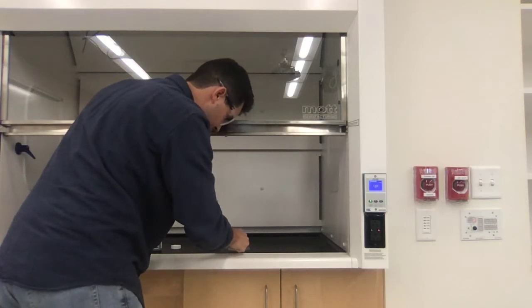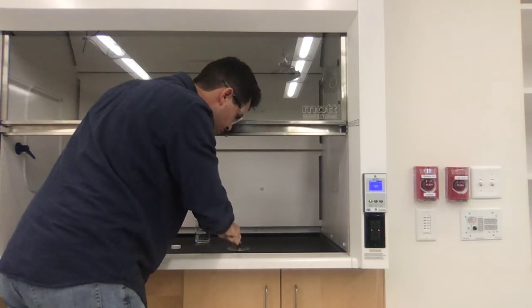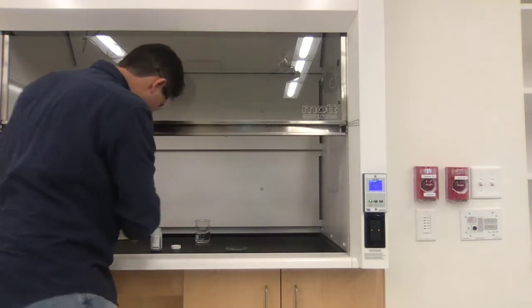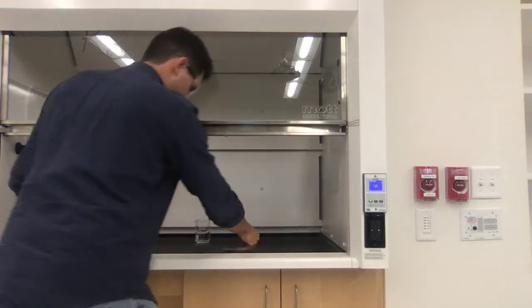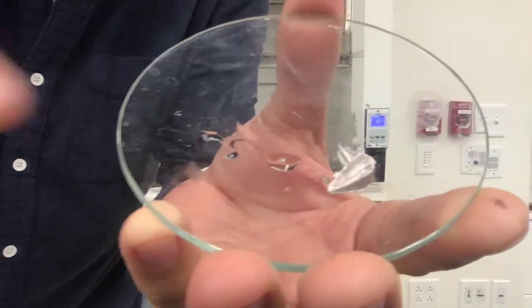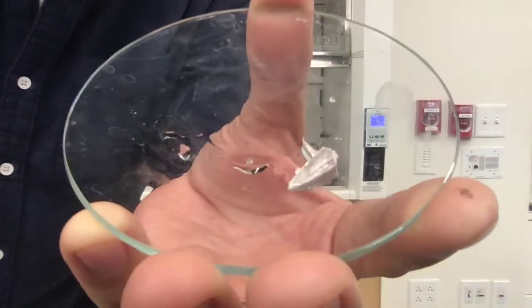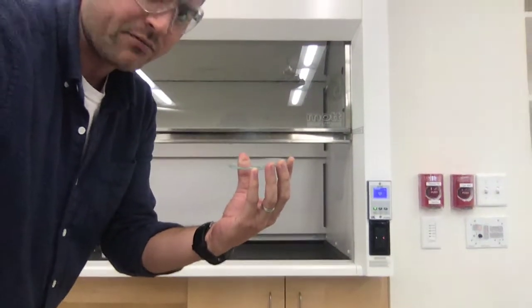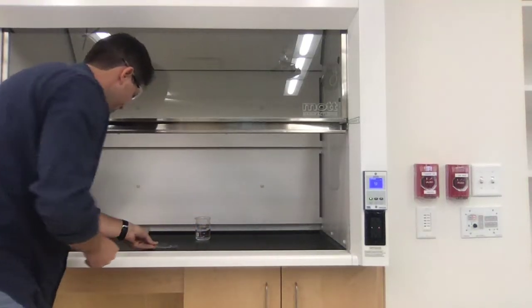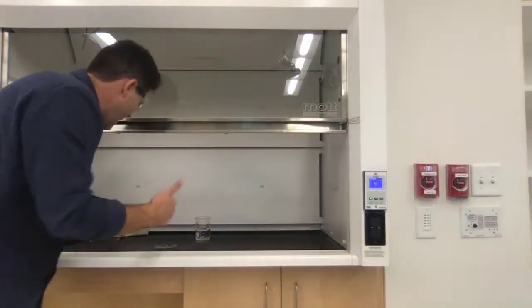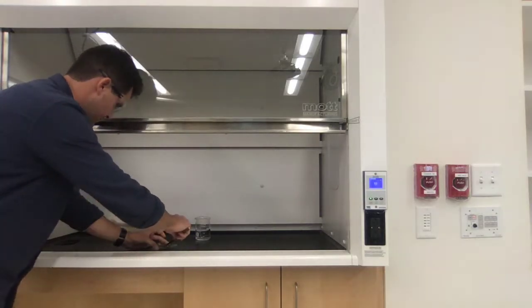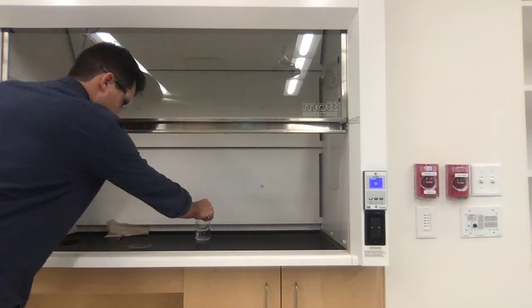Let's see if you can see. I'm going to try and make sure you can see what's going on over here. I'm going to get a little piece of it out. Let you see what it looks like here. It's actually super smooth, or smooth and kind of soft, actually. So, let's go ahead and take a peek at this thing. I'll bring it real close to you. You can get some observational data. Can you see how shiny it is? Right? Can you see? It's very shiny in there. It looks like metal, but when I was trying to chop it, my little knife moved right through that piece of metal. Let's go ahead and see what happens when I add this stuff to water. Instead of adding water to it, I'm going to add it to water.